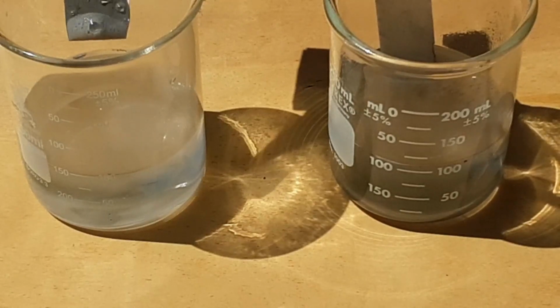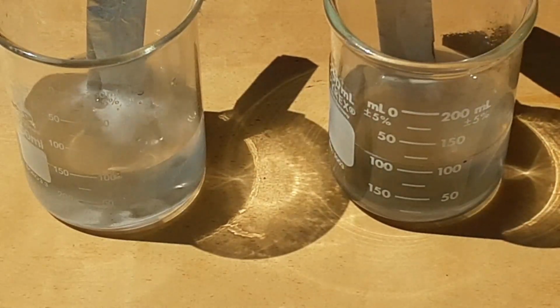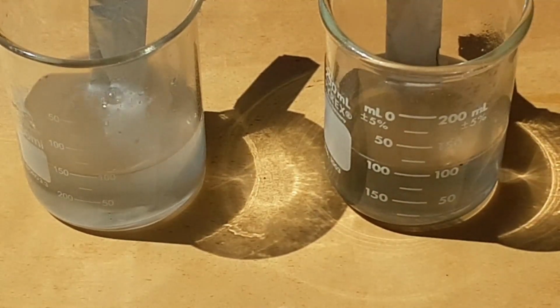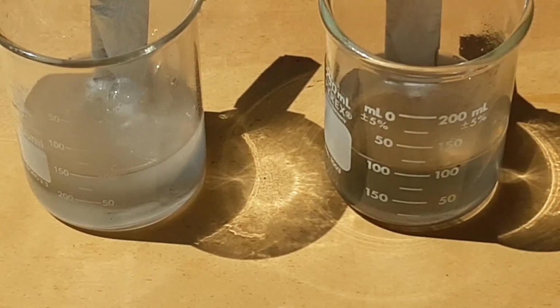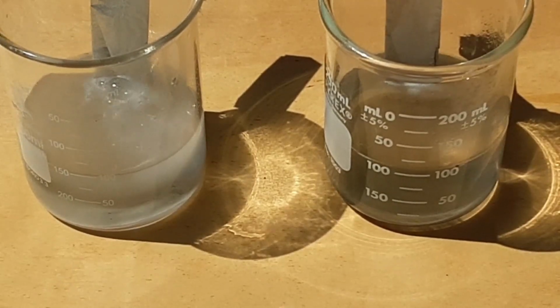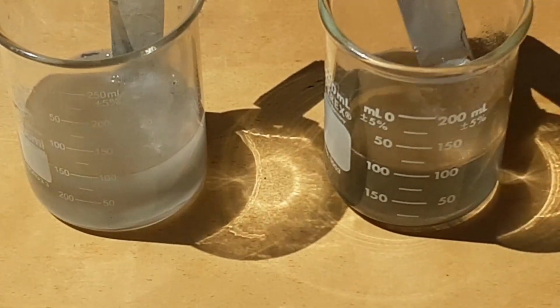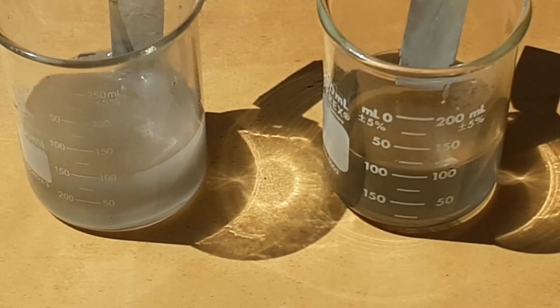Huh. That's unusual. That is 4 layers thick of heavy-duty aluminum foil. That kind of tells me that this potassium hydroxide solution is actually stronger than the sodium hydroxide solution. And I'm just not quite sure what to make of this at this point. 11.22 grams seemed like a high number for a 100 milliliter solution, so I don't know if I miscalculated the molarity, did something stupid. But yeah, in basically 5 minutes it ate through 4 layers of heavy duty aluminum.